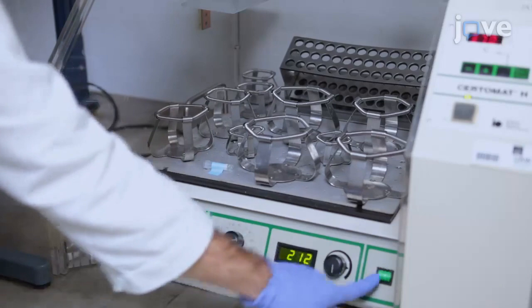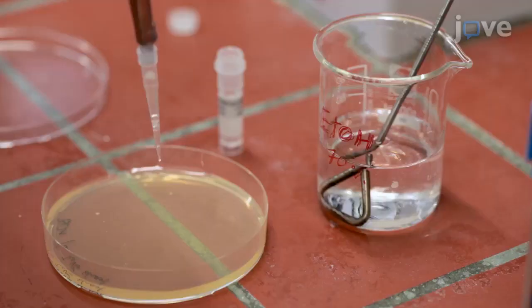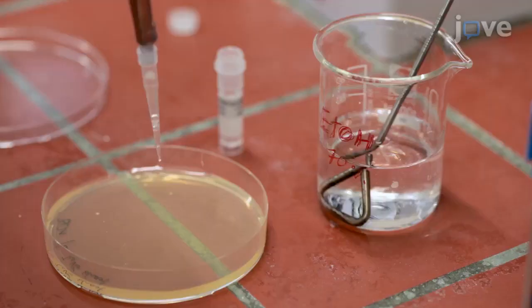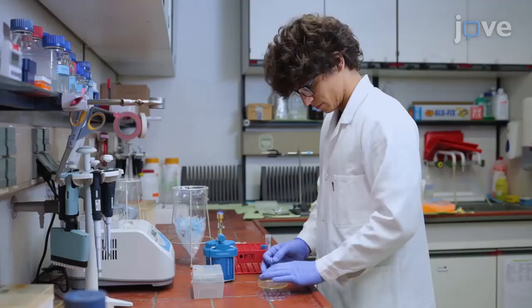By using polyhistidine-tagged proteins in combination with nickel-NTA agarose resins, the immense selectivity of affinity chromatography may be employed at low cost. For most purposes, protein obtained at this quality may already suffice.